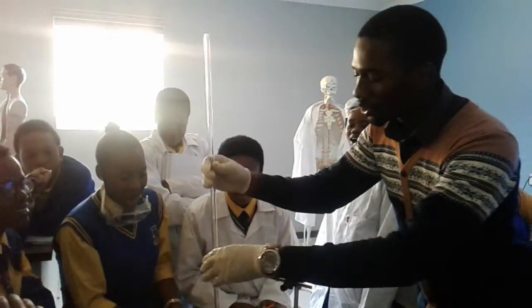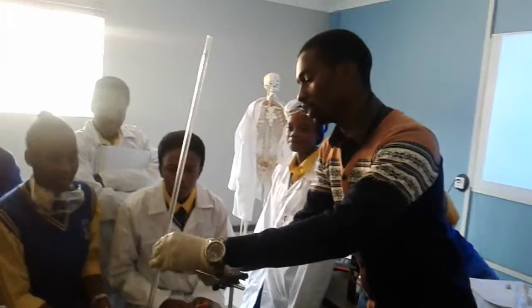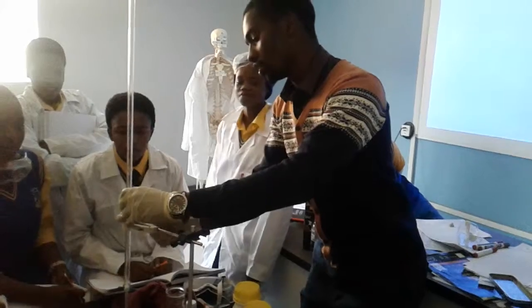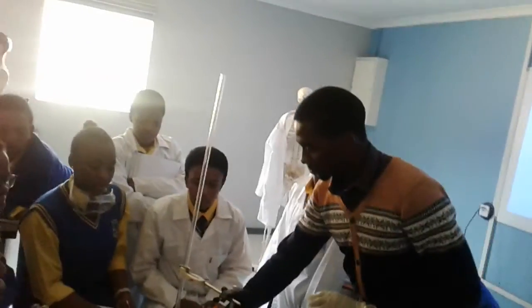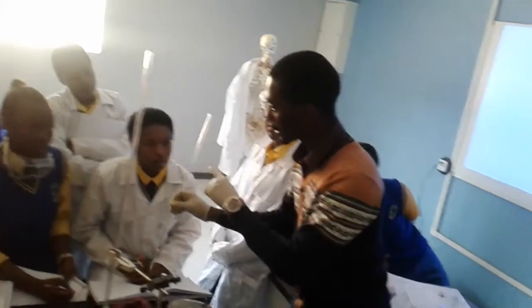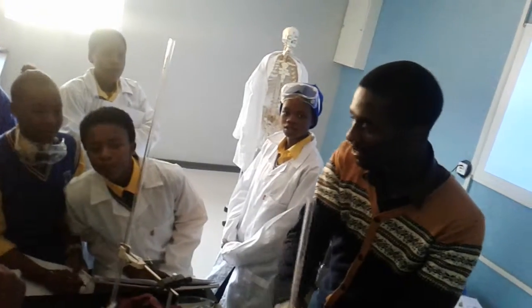Alright. Now, look here. And then what you do, guys, I'll give you a drawing. I'm going to show you what you need to do. You're going to do a formal write-up as well. So please listen properly. Okay. I close this thing. Now, is this a burette or pipette? Burette. Where does it start measuring? What's the initial measurement?